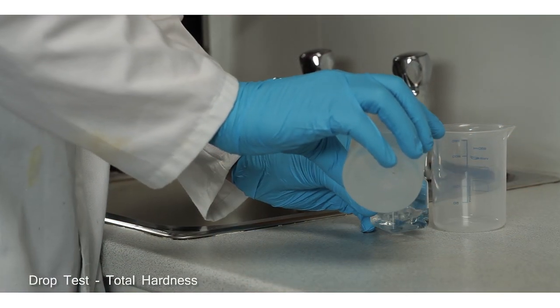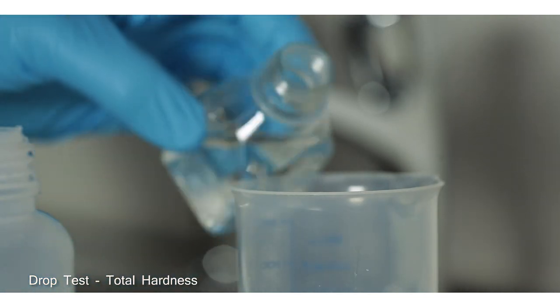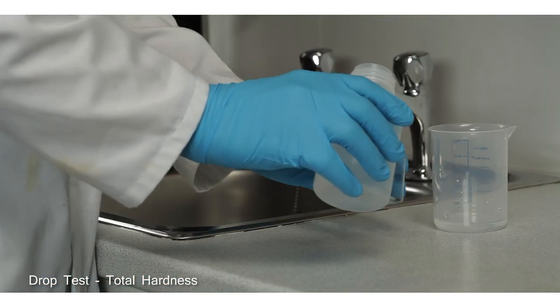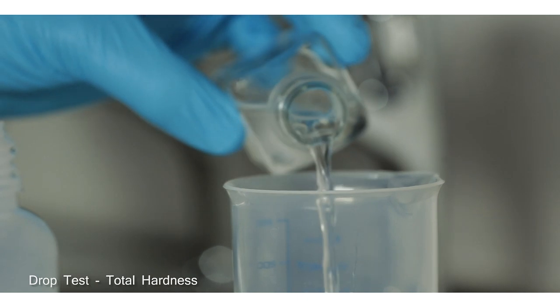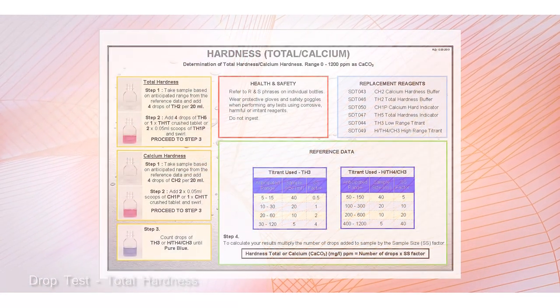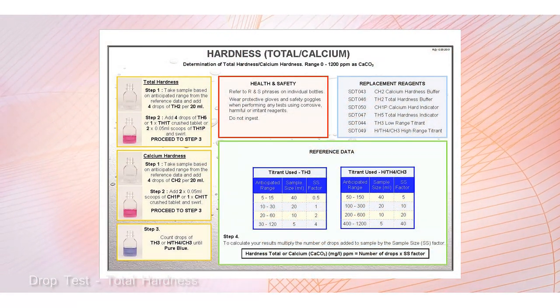Rinse out the reaction vessel with sample to avoid contamination from a previous test. Choose a sample size and titrant according to the anticipated range of the sample using the reference data provided.